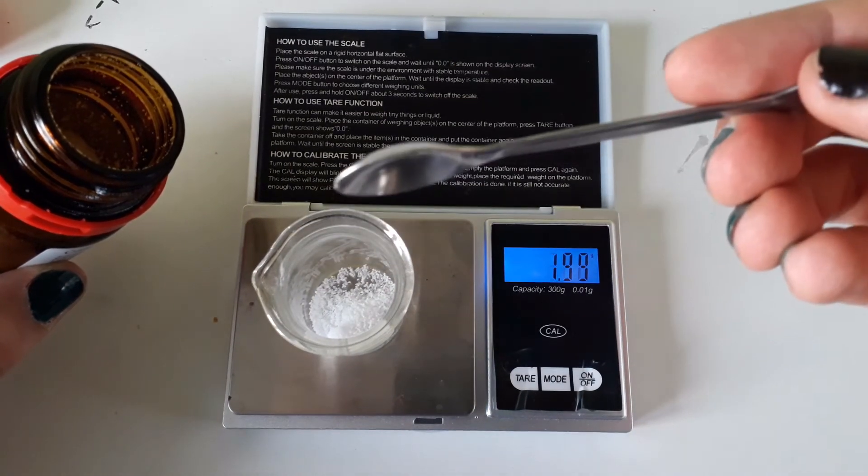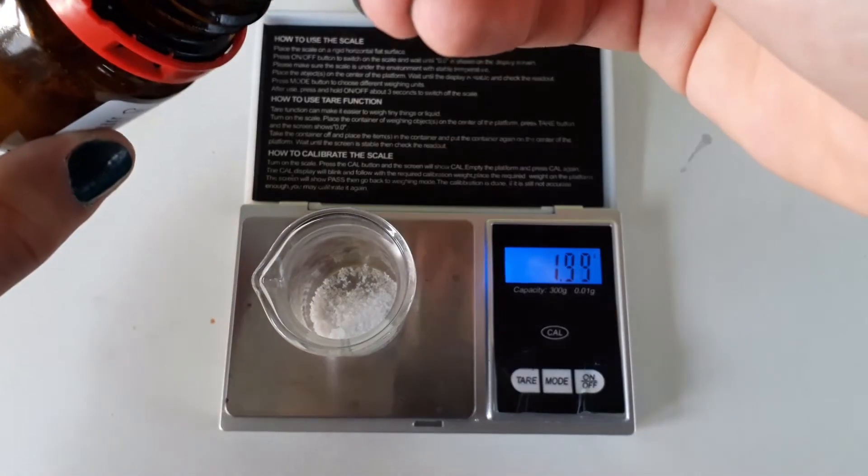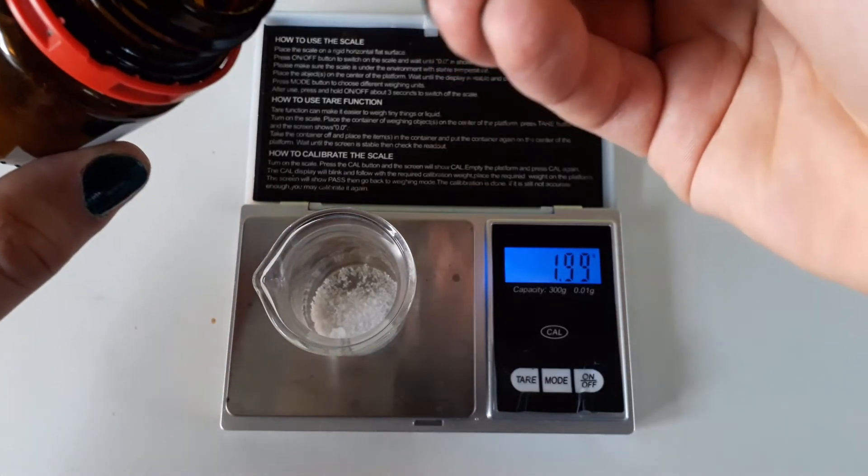For the prep of cesium sulfate I used 2 grams of cesium chloride starting material that I weighed out into the beaker.